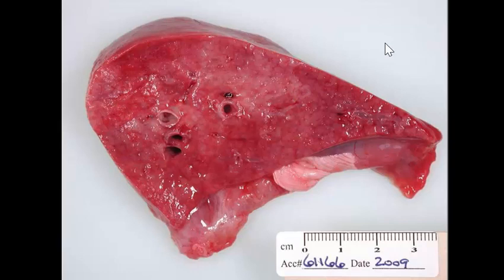Two other possible lesions in this animal. Well, if you know that this is CAE virus, I would probably write down arthritis and encephalitis. The encephalitis is generally restricted to young animals. Older animals will develop mastitis and arthritis. So any of those 3 would be fine.